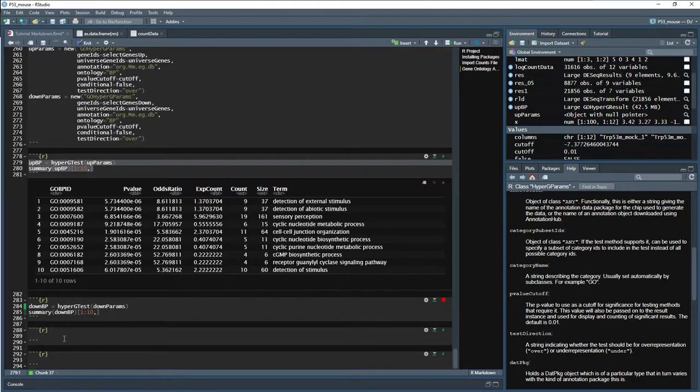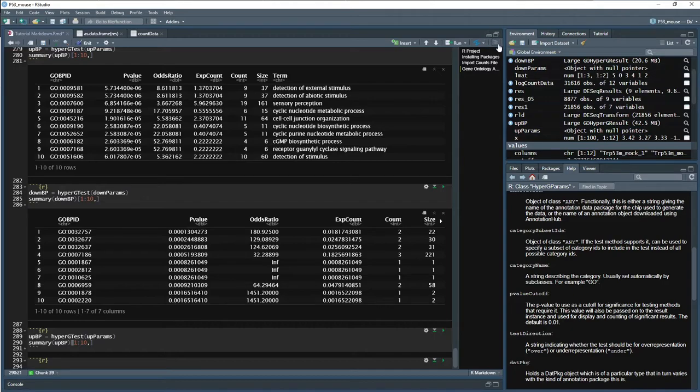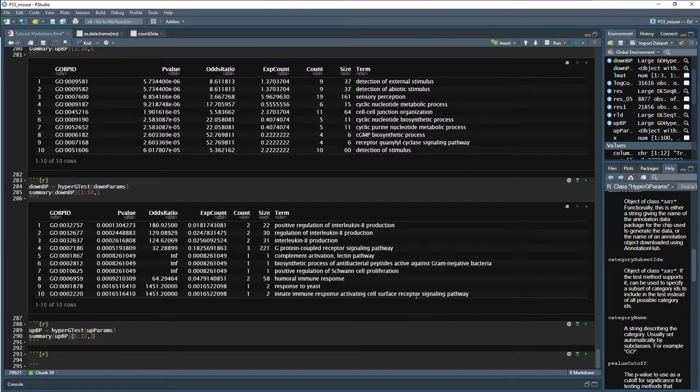So we have up BP, and then we would expect in down BP some of the things that if P53 wasn't there, that would continue happening. So P53 stops cell growth. We would expect to see some of that cell growth. It stops, it doesn't have cell death. So, oh, this is too wide. There we go. So there's still some signaling happening. Nothing stands out. Positive regulation of cell proliferation, so growth. Let's go ahead and we have up BP. Well, let's copy down BP here.